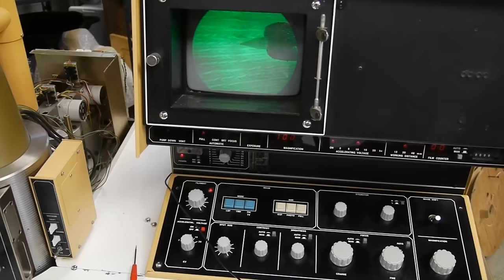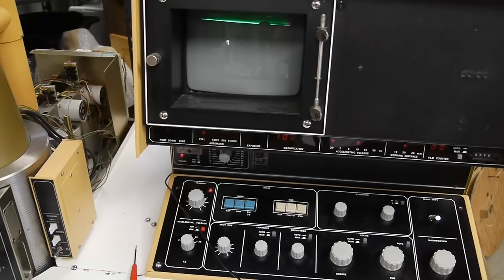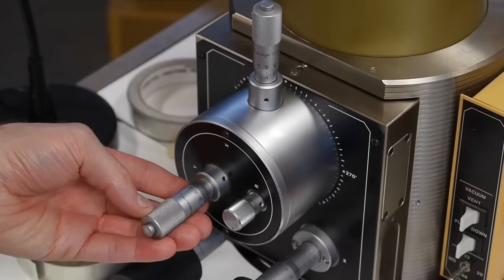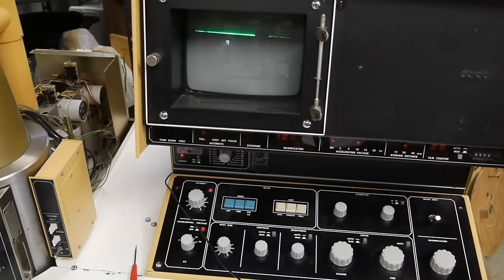In order to make a decent image the scanning electron microscope requires about 10 seconds per frame to scan it out. So what I did was use the micrometers on the stage to move the record by a very tiny amount about 50 microns and then take a still frame. I'm using my Tektronix MDO oscilloscope to store the data.